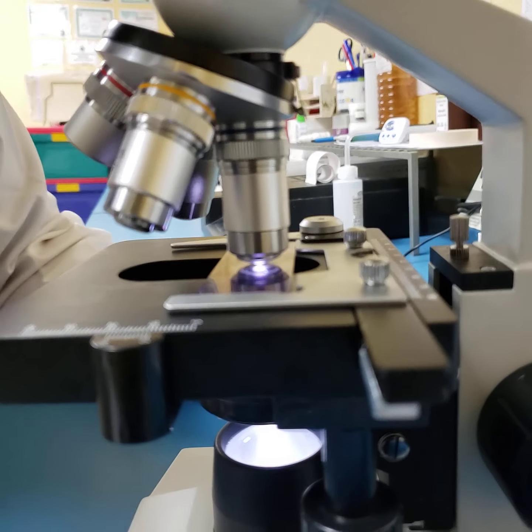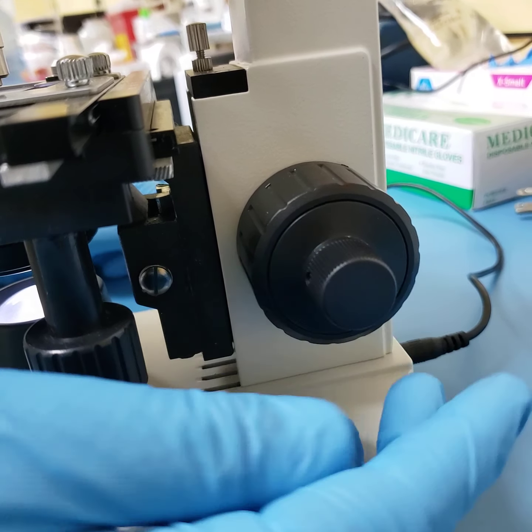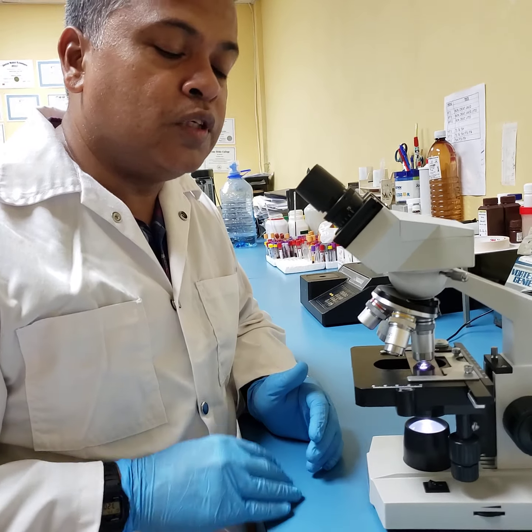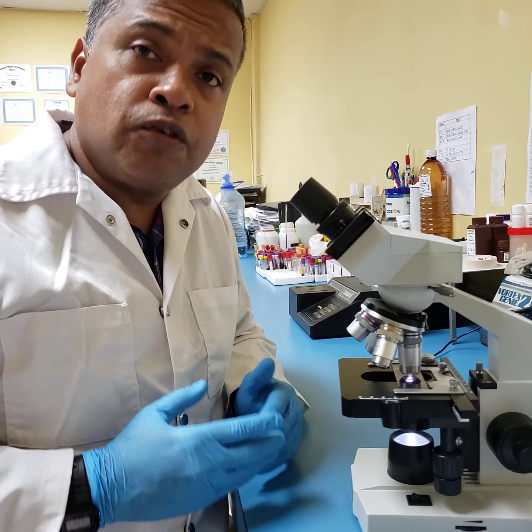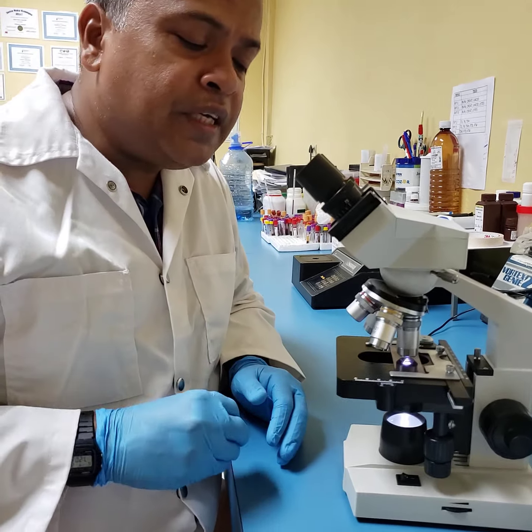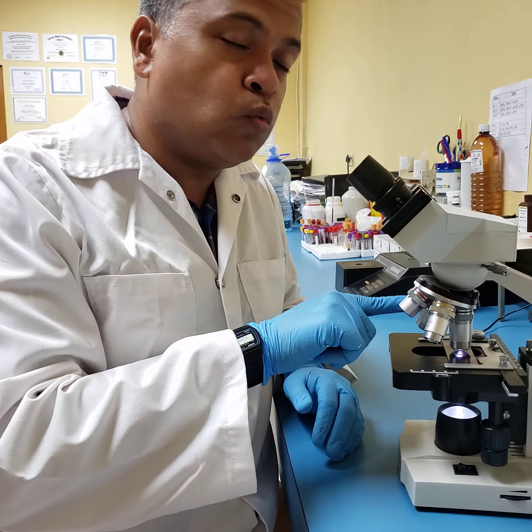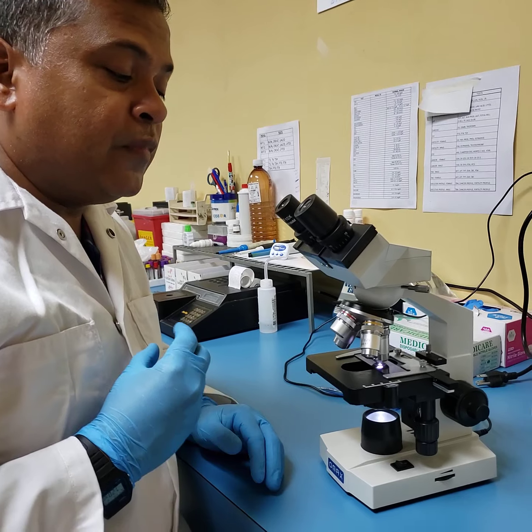Now what we do here again, if you look at my finger, I'm just adjusting the fine focus knob slightly back or forth, and now my image is bigger, it is clearer, and I have not used my coarse adjustment knob since the beginning of adjustments. This times 40 is also, as I mentioned before, called the high dry. One of the most dangerous, unfortunate things that occur in microscopy is when technologists, trainees, assistants, anyone who utilizes the microscope, sometimes get oil that is only supposed to be used on your times 100 or oil immersion lens onto the 40, and I'll show you how that could happen.